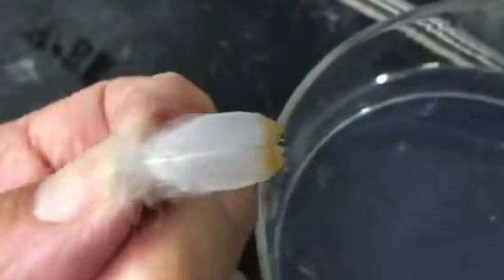You can put it back on there and it floats just fine. In this case it is wetted. You can see like the paintbrush effect, and I put it back in the top of the solution and it partially submerges.